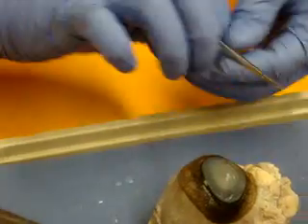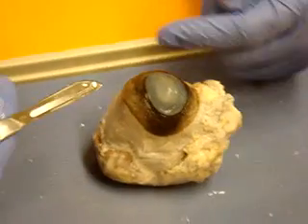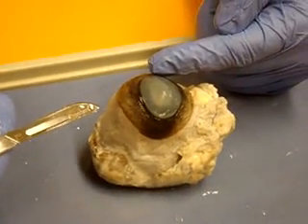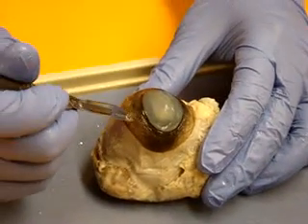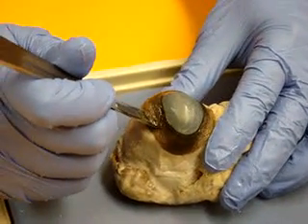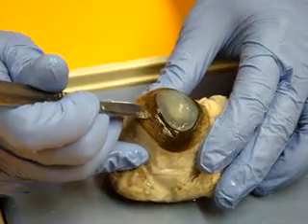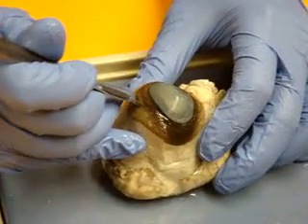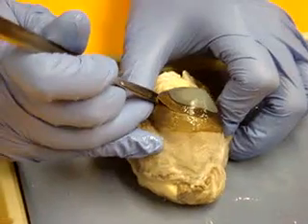Now we are going to open up the eye and separate the anterior cavity from the posterior cavity. So I'm cutting through here and I'm going to take off this section.